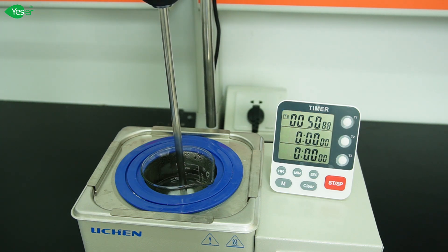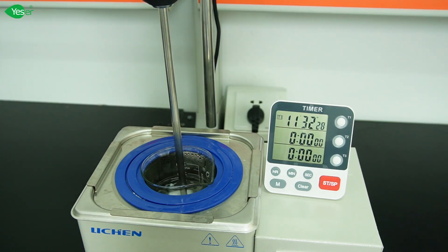But cleaning isn't the only thing SLS is good at. It's also a fantastic foam booster, providing that rich luxurious lather that consumers love in body washes and shampoos. This lather isn't just for show. It helps to distribute the product more evenly, ensuring thorough cleaning. We need to heat up our water solution in order to effectively dissolve our SLS needle.